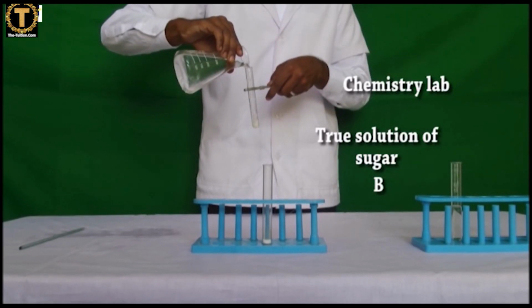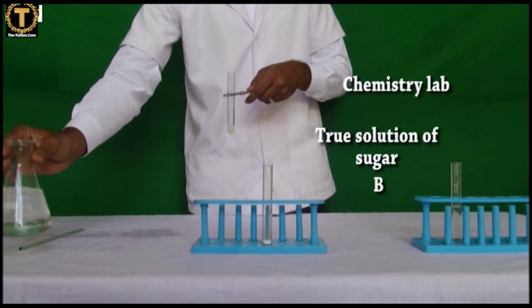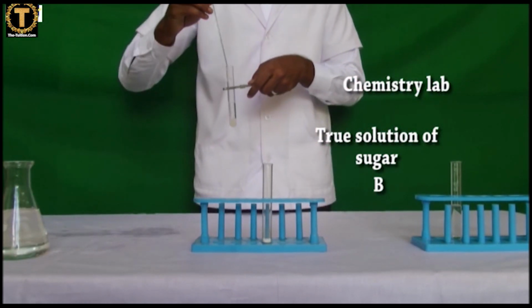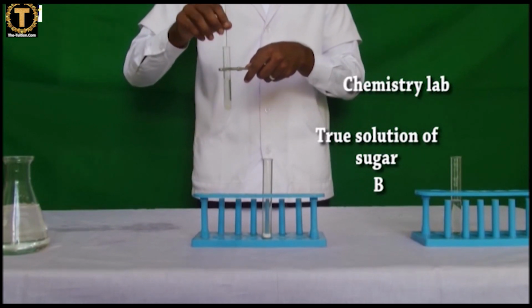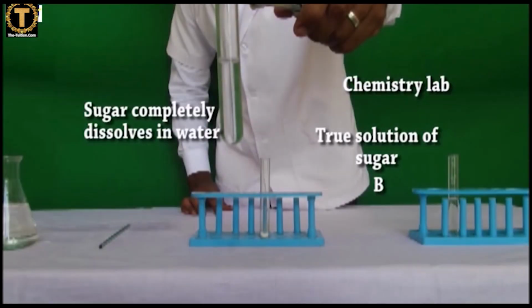True solution of sugar. Take a clean, dry test tube and add 2 to 5 ml of distilled water in it. Pour a few sugar crystals in it and stir the content with a glass rod. The sugar dissolves in water to form a true solution.